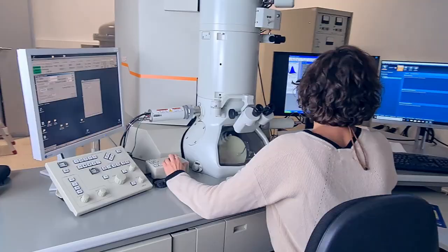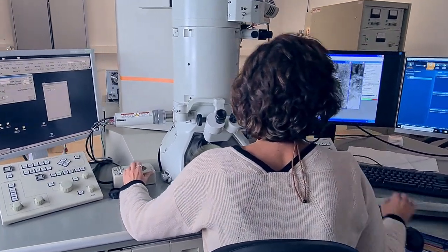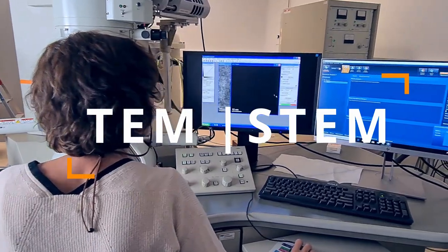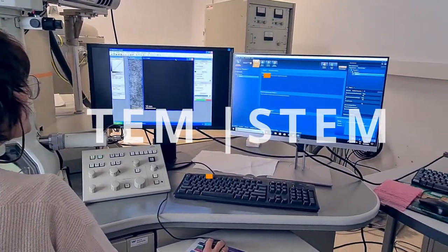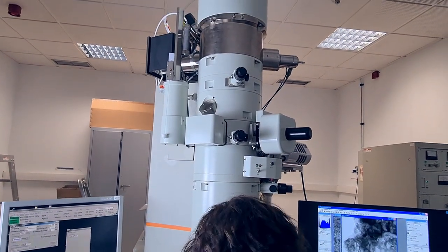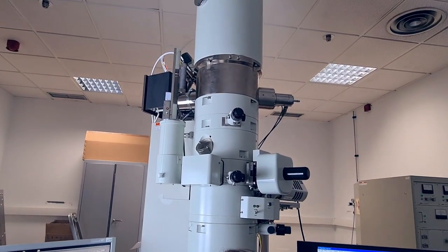Transmission electron microscopy is based on the interactions of an electron beam with the atoms present in a sample. We use TEM to see the size, morphology, and also composition of the sample, and to study the microstructure of the materials at atomic level through high-resolution TEM and electron diffraction.